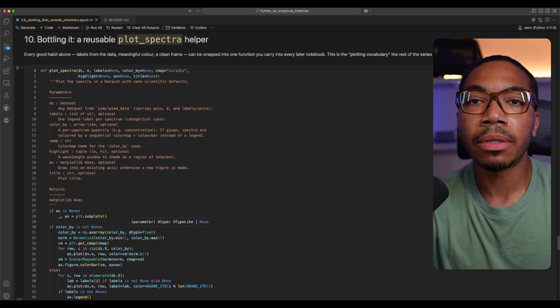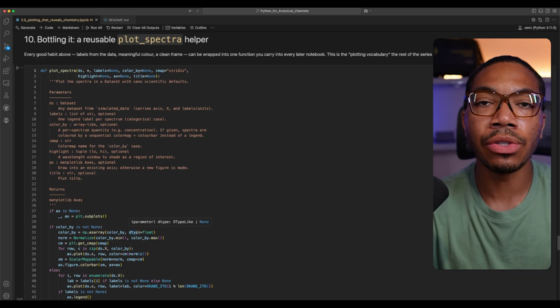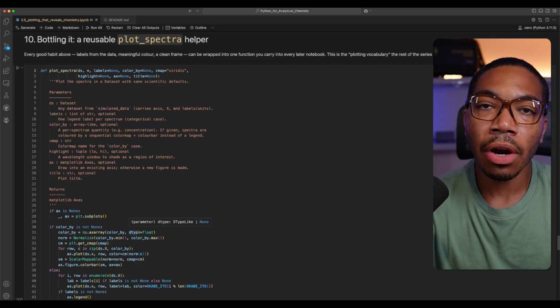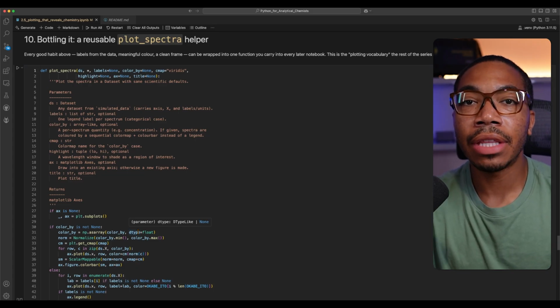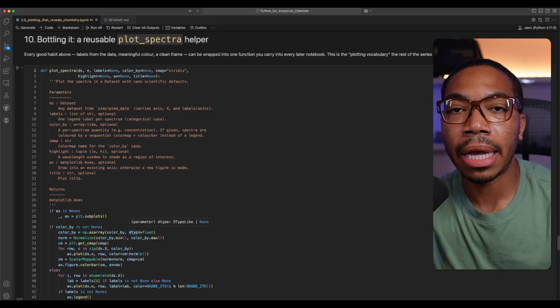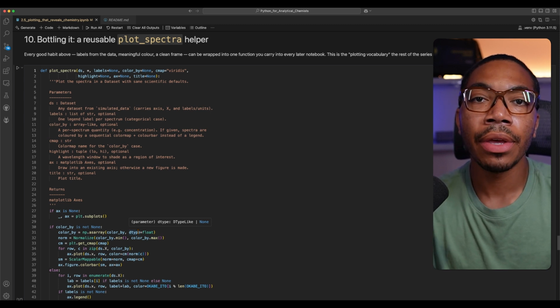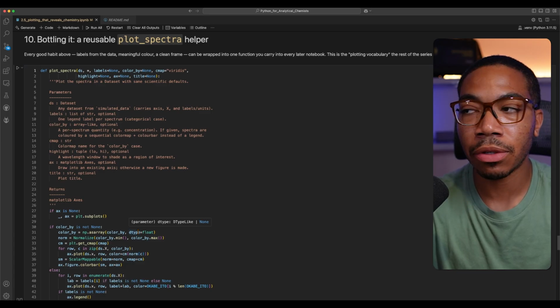Now, I want to leave you with some code to look at, and this could really help you as you start making more plots using Python in the future, and that's just to write a function. Now, functions are little code snippets that you can reuse, and this will allow you to take everything we've talked about with the right color map, the right publication ready styles, and bottle all that up into a single call that allows you to just put in your data, add the title you want, and output a properly rendered spectrum.